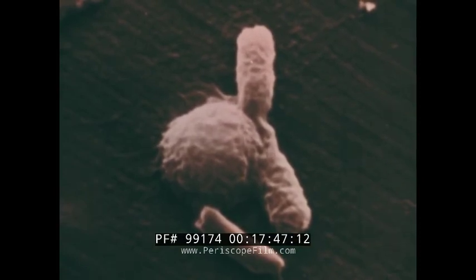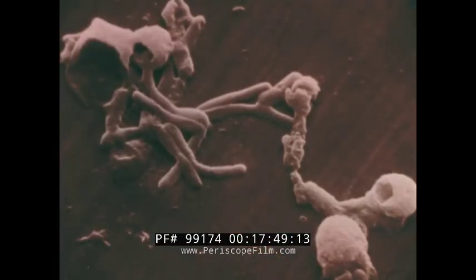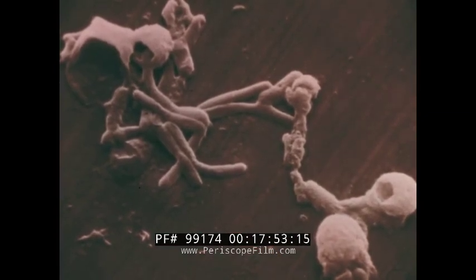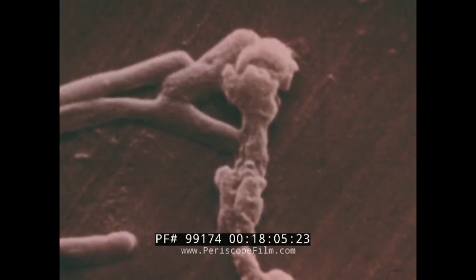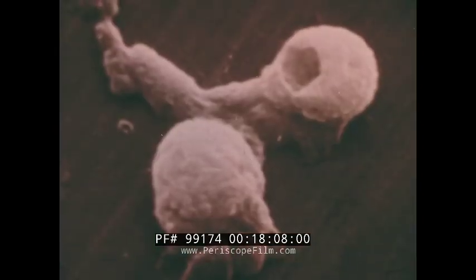but no wall. In this field, we see the full progression of the conversion of E. coli to L-form organisms in the presence of high concentrations of penicillin. First, the cells elongate. There are extrusions from the damaged wall. The formation of L forms. The membrane collapses.